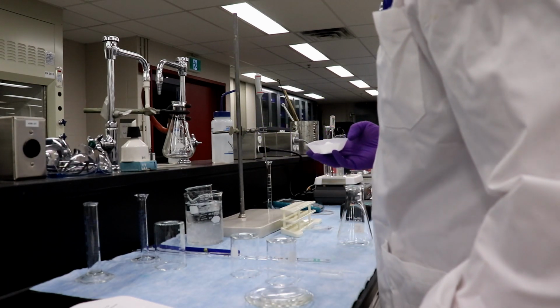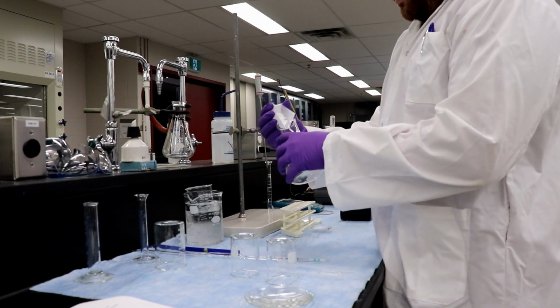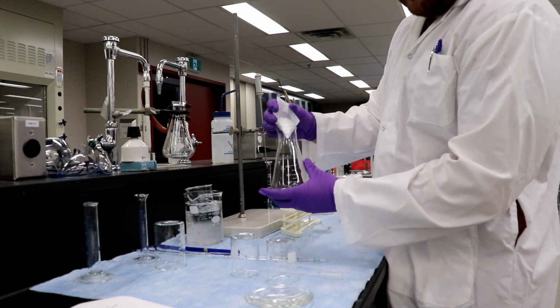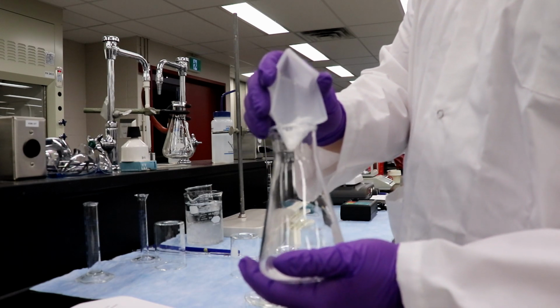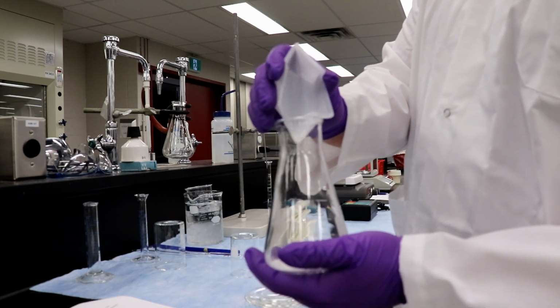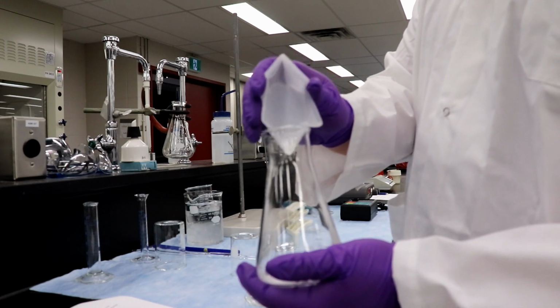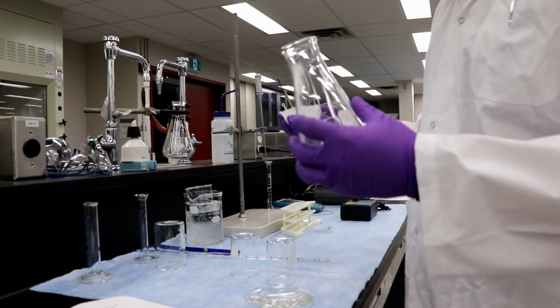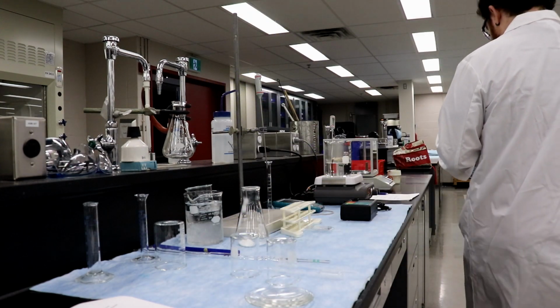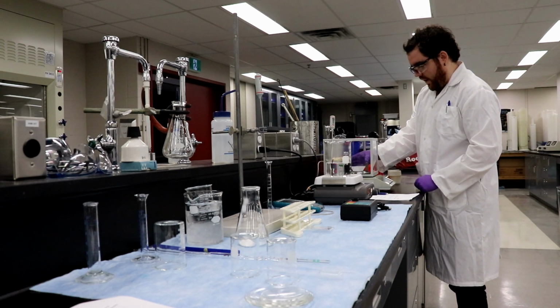Okay, place in the 250 milliliter Erlenmeyer flask. This guy right here. So we're going to fold that, drop that in right there, and as you can see there'll be a lot of white powder left over. Now I haven't tared the balance, so when I put this back on there, it'll still have the weight of the boat recorded, and then whatever's left over will tell me what's stuck, and then we can do the weight by subtraction.